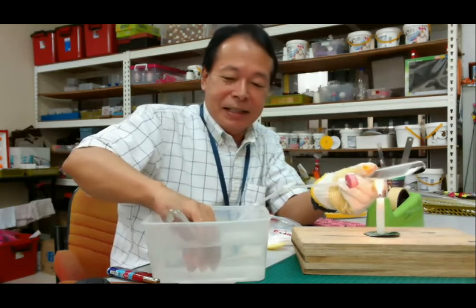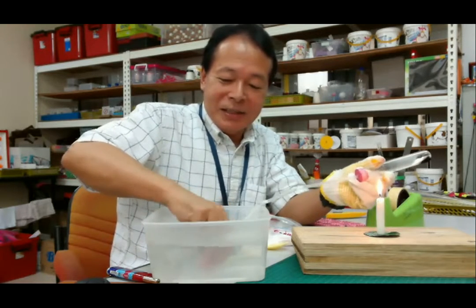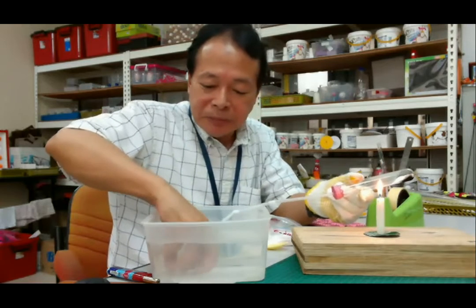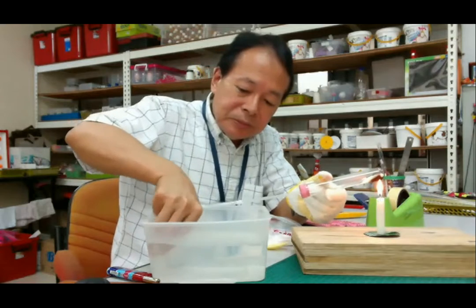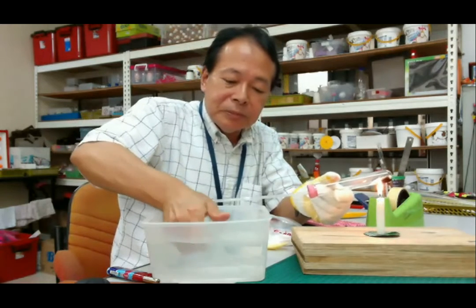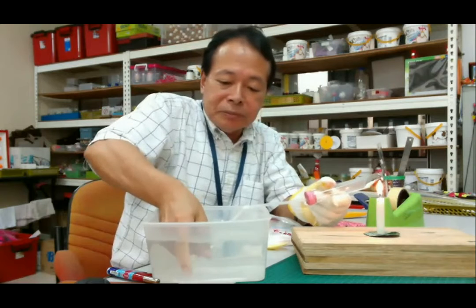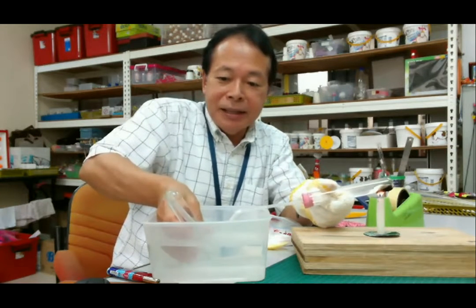Okay. Oh, sorry. Just a moment. Okay. Then heating again. Sorry.